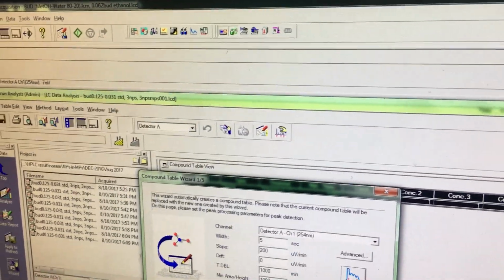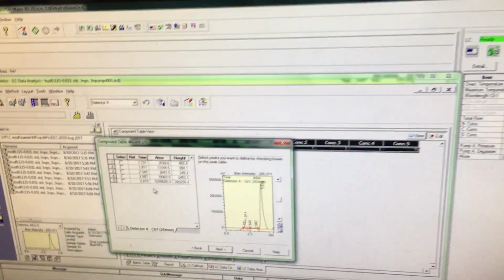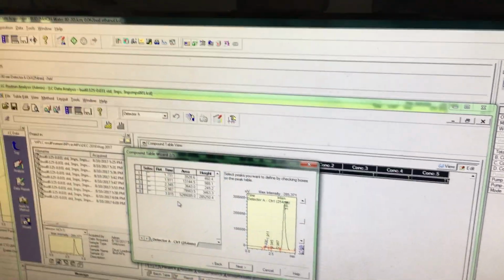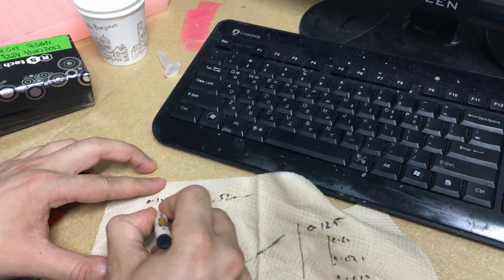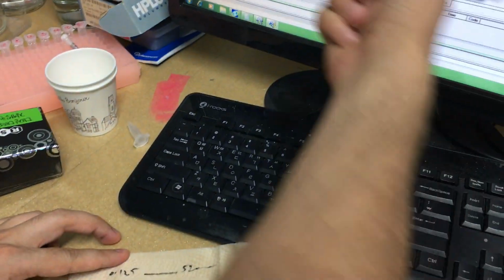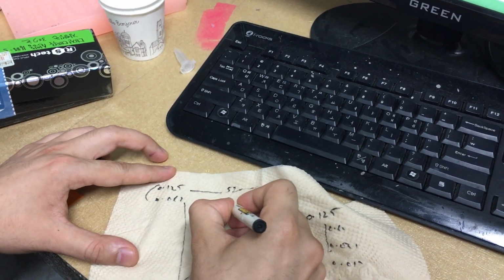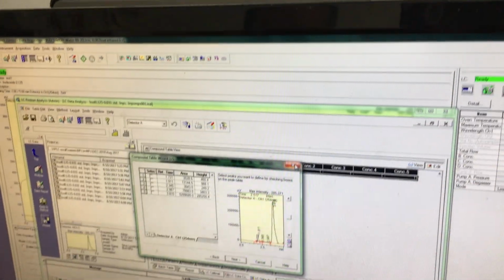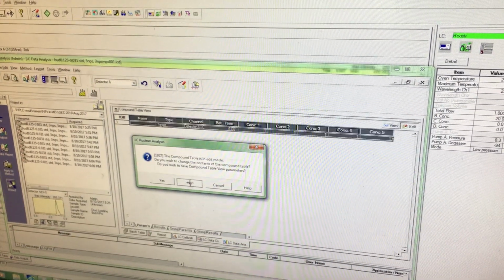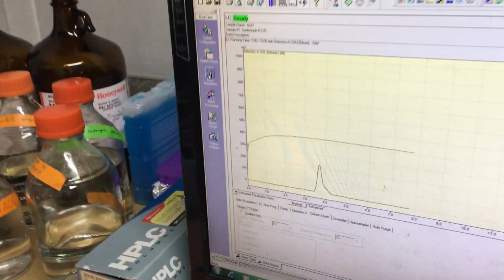Okay, and this one you can remove. Another point: in HPLC we check the area, and with UV we can check absorption. So the 3.5 area is 5299098. So in Excel, 0.125 and the area is like 5.2. Similarly for 0.062, it will become half, a dilution. So the area will become like 2.5, and similarly from this dilution you can get the peaks. Then when I find the peak is good and it's working, you can go to whatever your samples, like 100, 200. So this is the method.